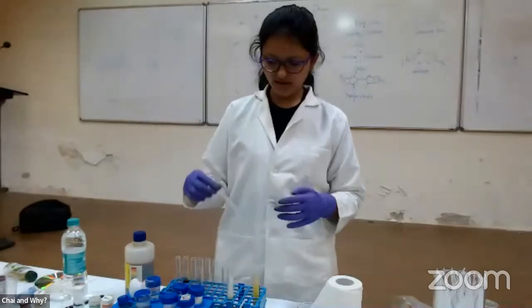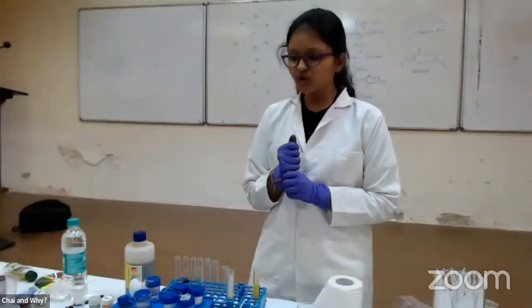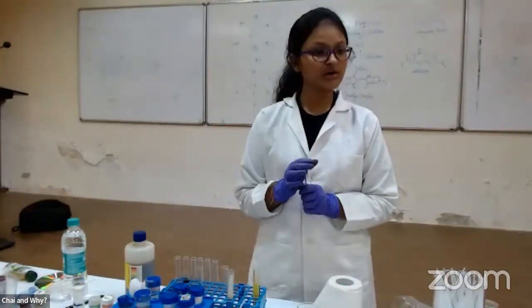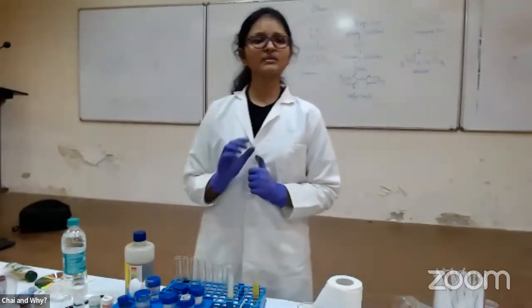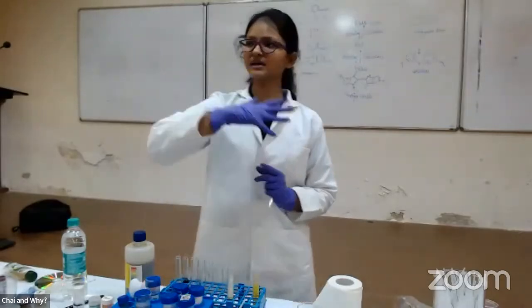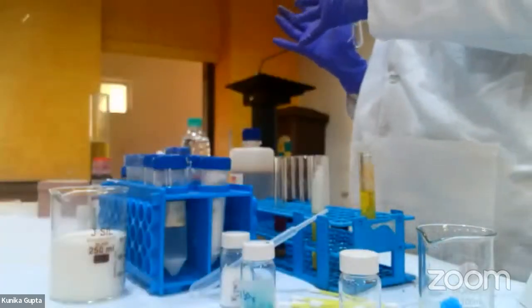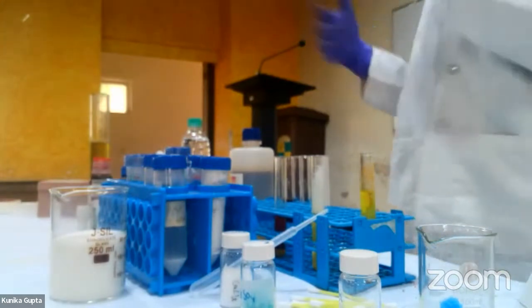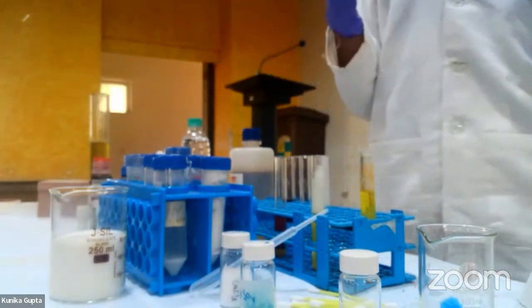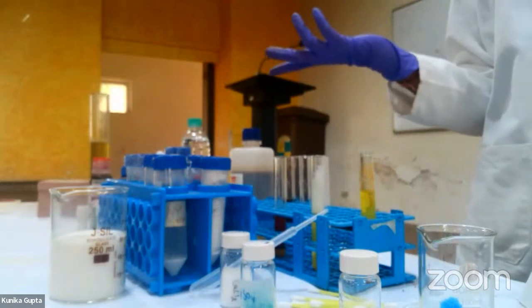Okay. So again, I take a test tube. So you know miscibility. There is something called miscibility, that organic things dissolve in organic, or like dissolves in like. So a hydrophobic thing will dissolve in a hydrophobic thing. Like you would have seen the oil does not mix with water, right?